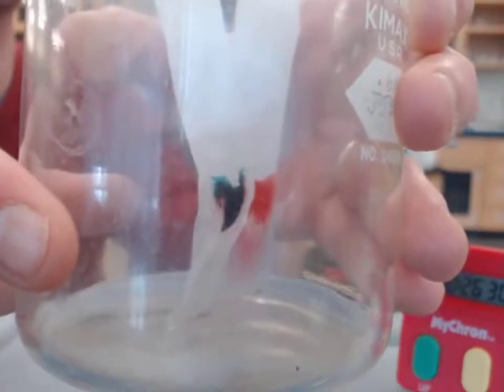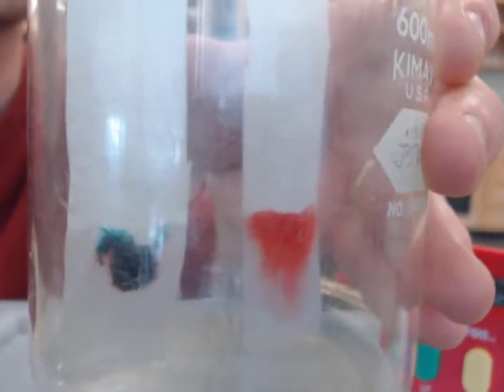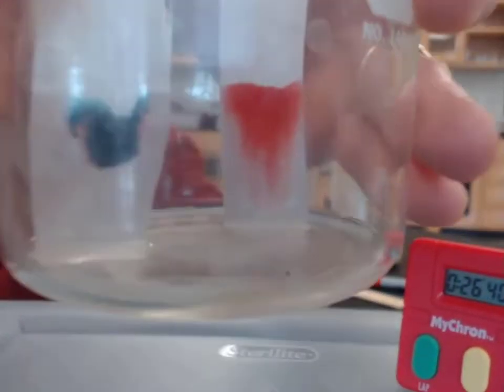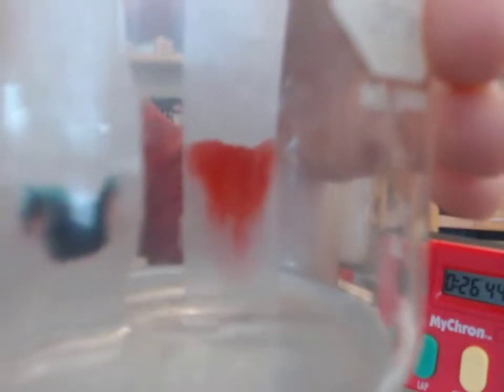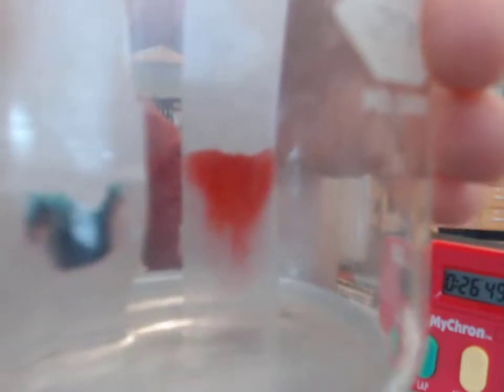We have a different shape of this black dot now. I see pink and a little bit of orange and red and the black ink now as well. See if you can see that. Much more interesting than what's going on with our red dot here. It has changed shape differently. That may be partly to do with the type of substances that make up that mixture.